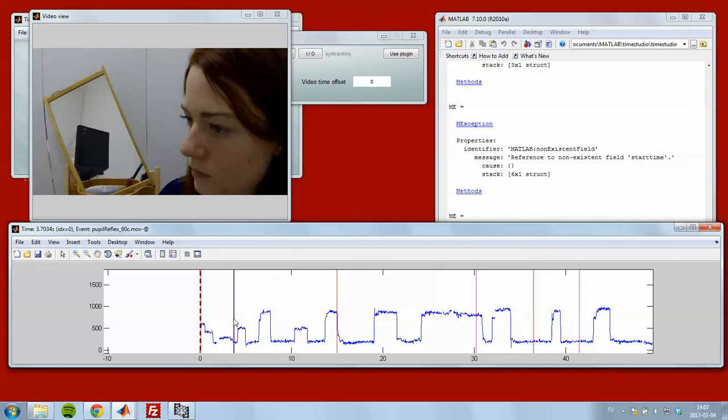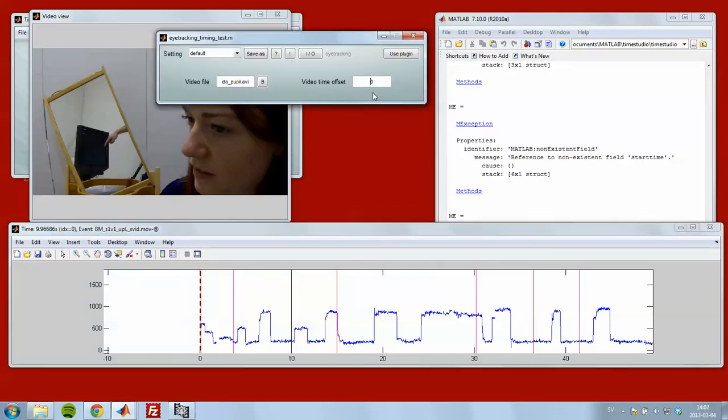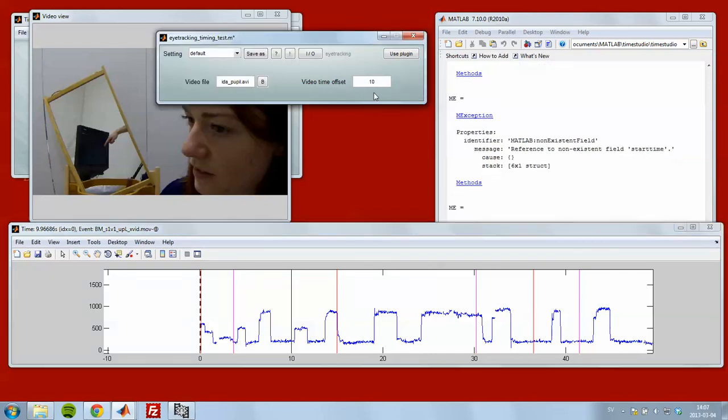You see that this event down at the timeline called pupil reflex start, if you look on the video, it actually starts here after the blue screen. So we take that time. You can see the time here, it's about 10 seconds. So I can offset the video for 10 seconds here. I press enter.